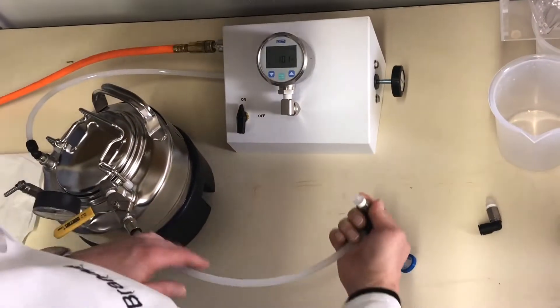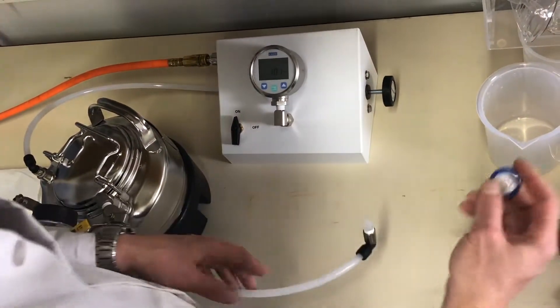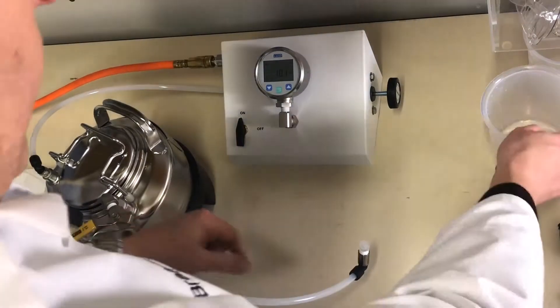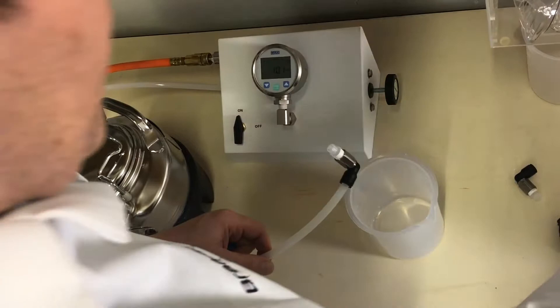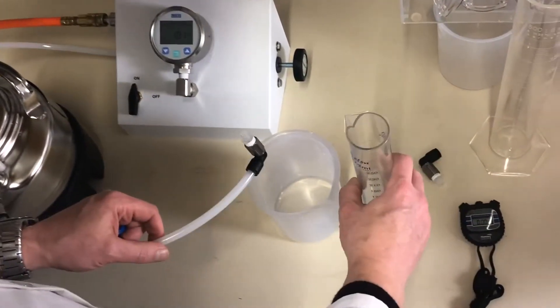Then we take our test filter, and a beaker, we'll gather our graduated cylinder as well.